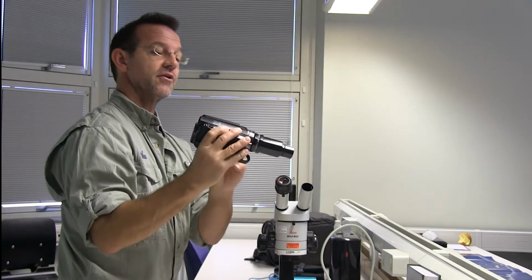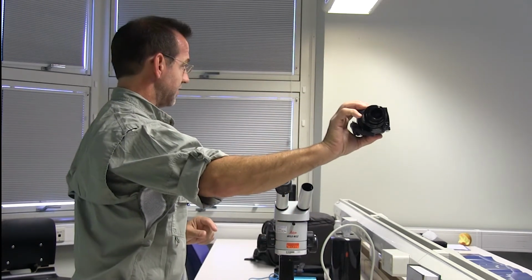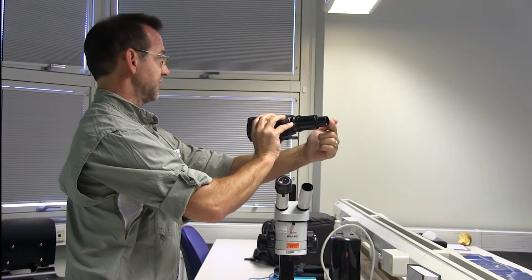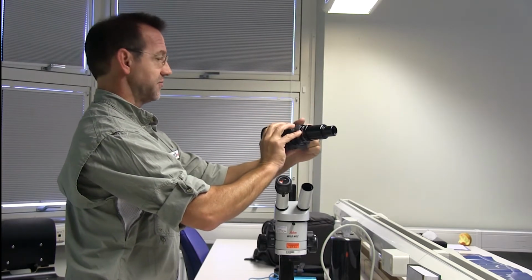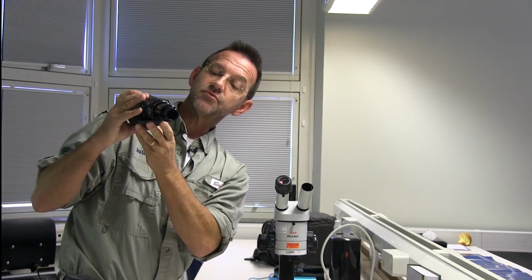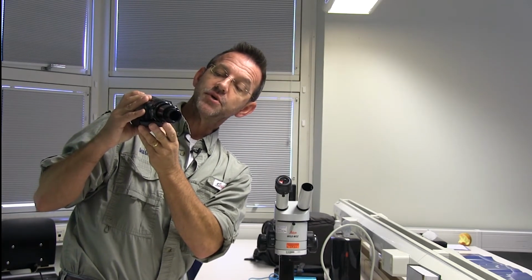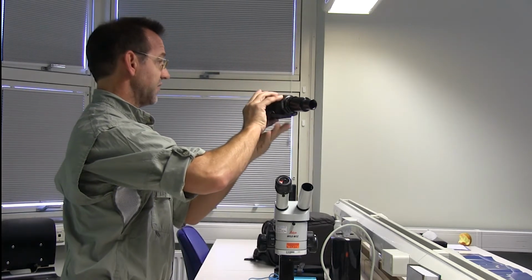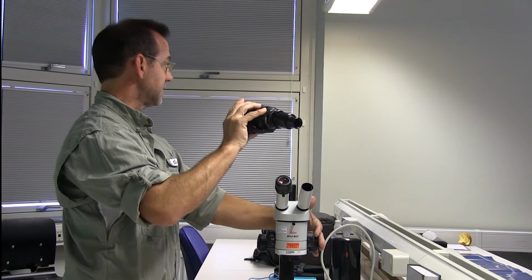And when you take it out, you can kind of see the circle there, because you have this vignette here. This is much smaller than the lens of the camera. So to get rid of that, you would have to zoom in like this to fill the screen, like that. That would give you the image under the scope then.